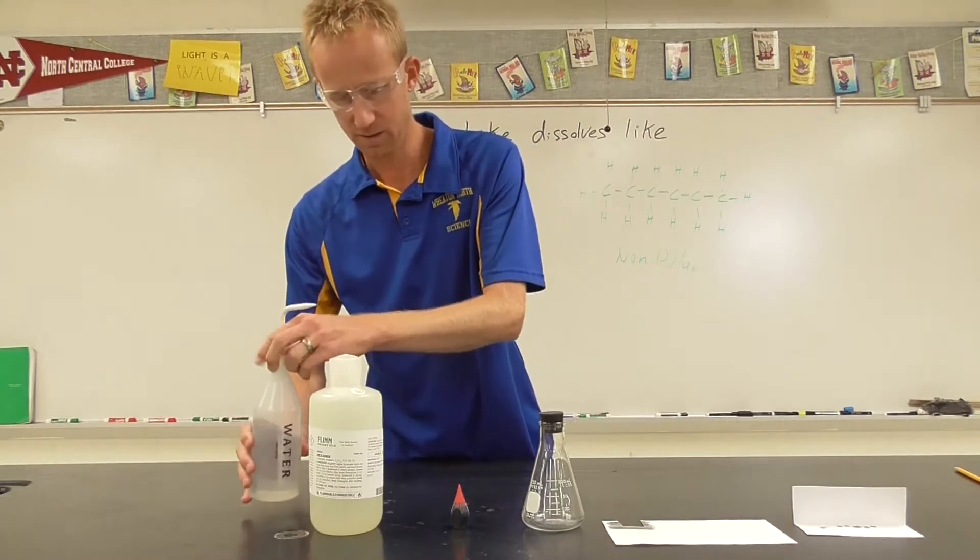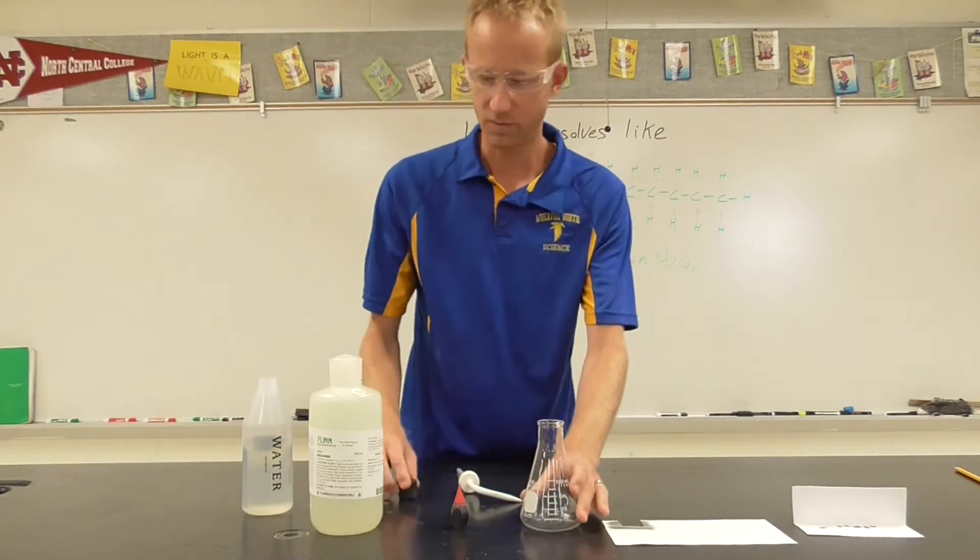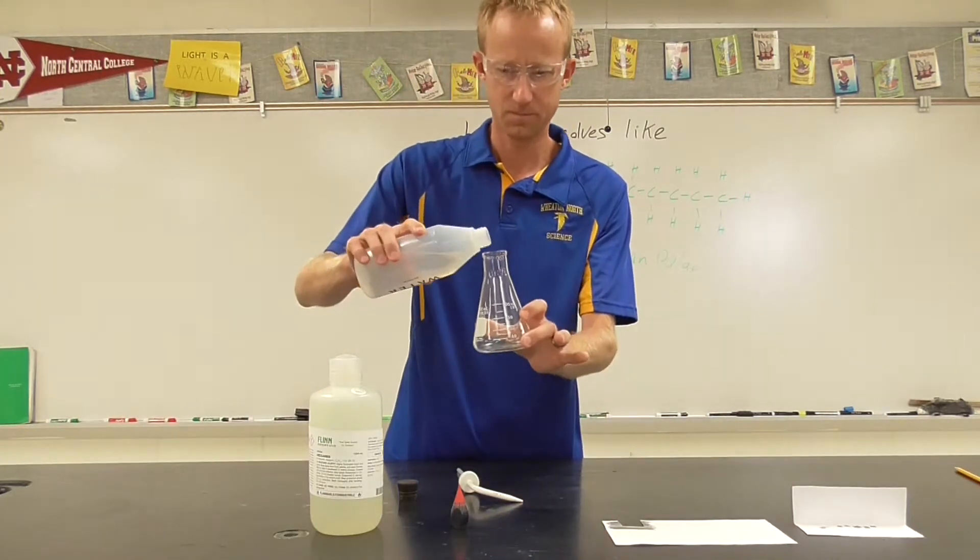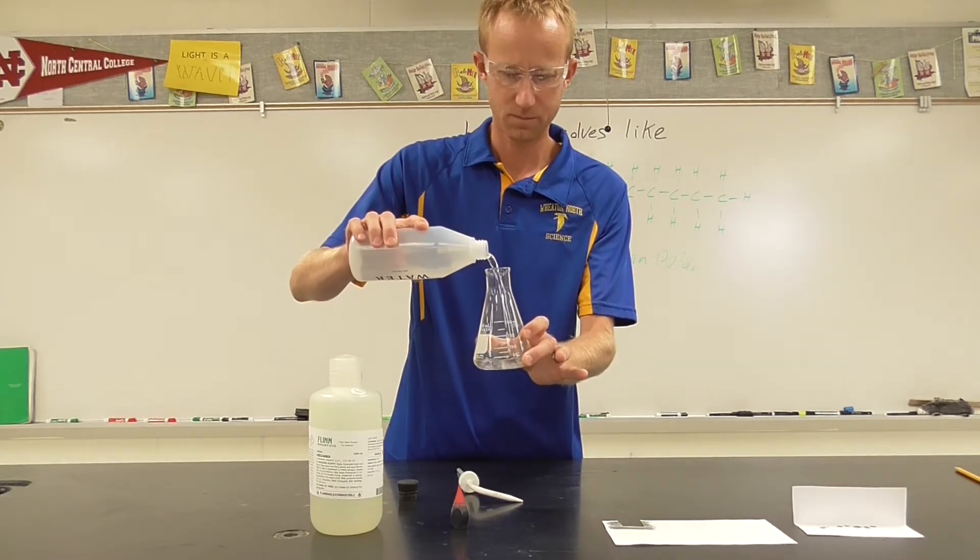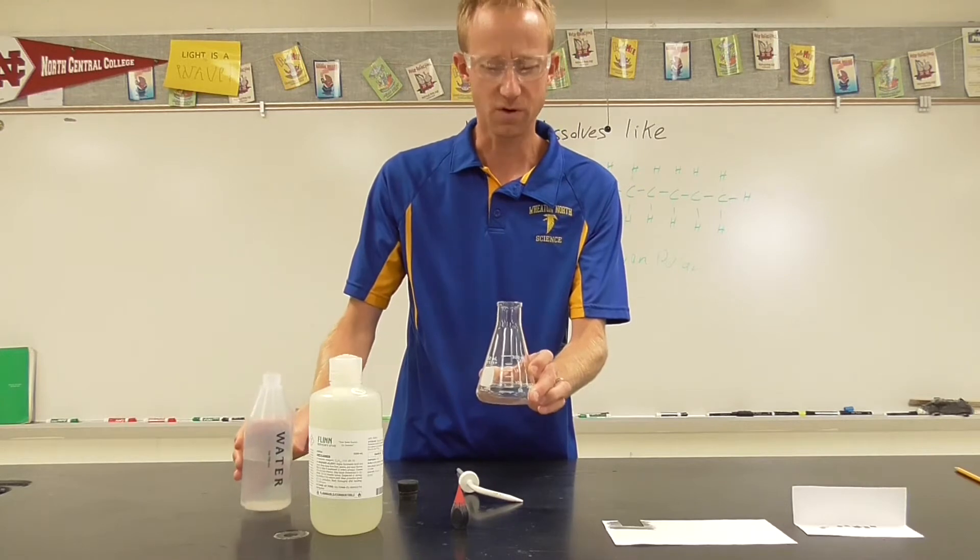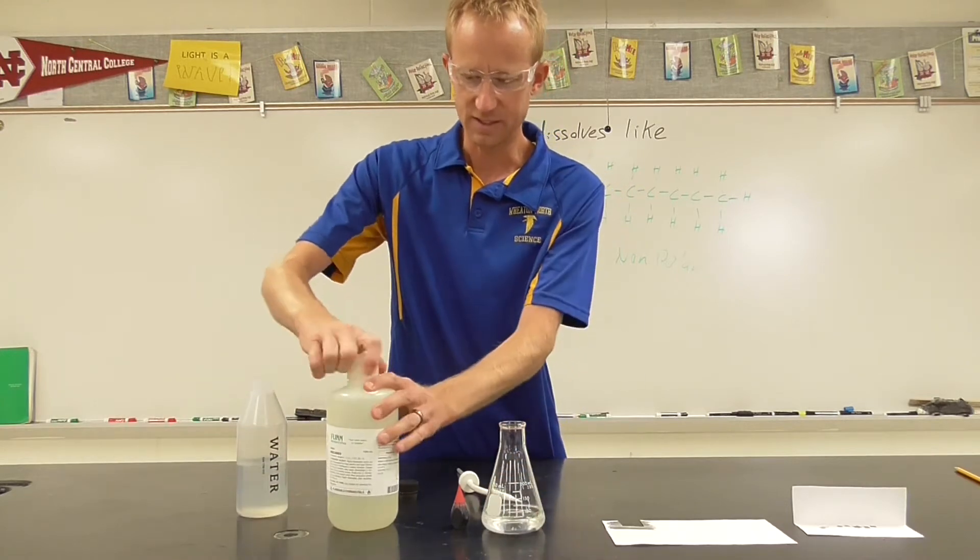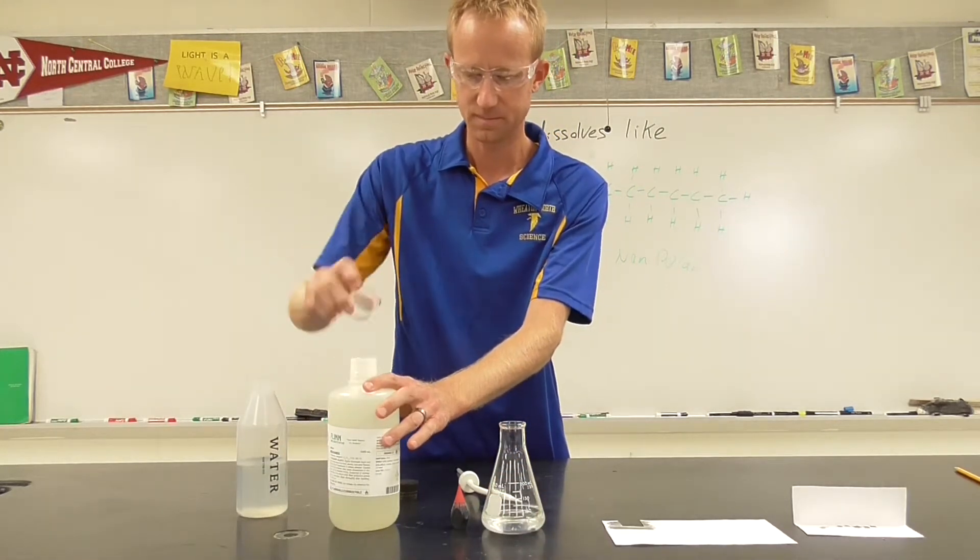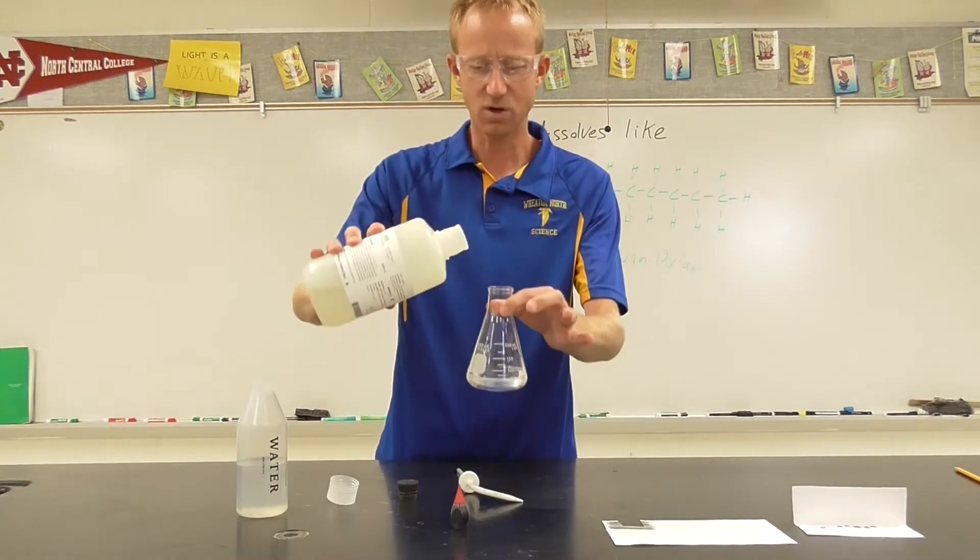So let's pour in some water into our flask. Remember, that's the polar solvent. Now, let's add a little bit of hexane. Remember, like dissolves like.